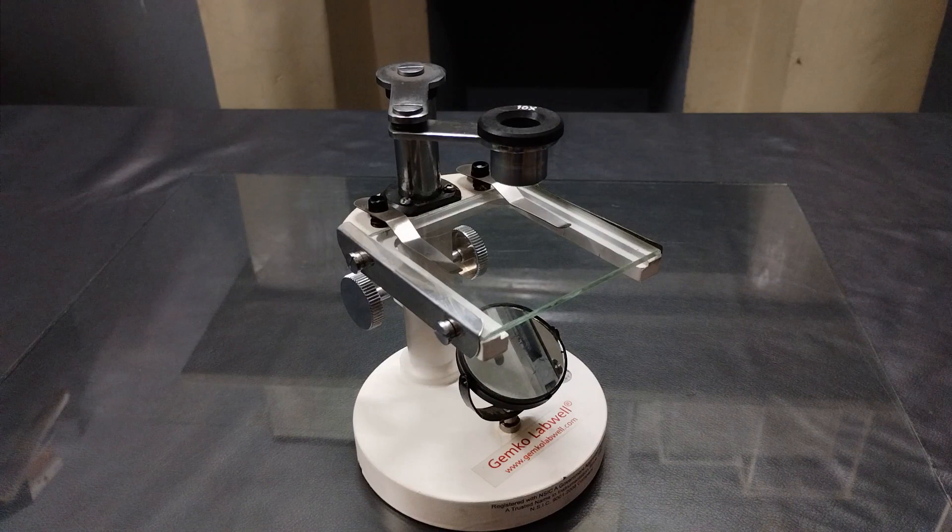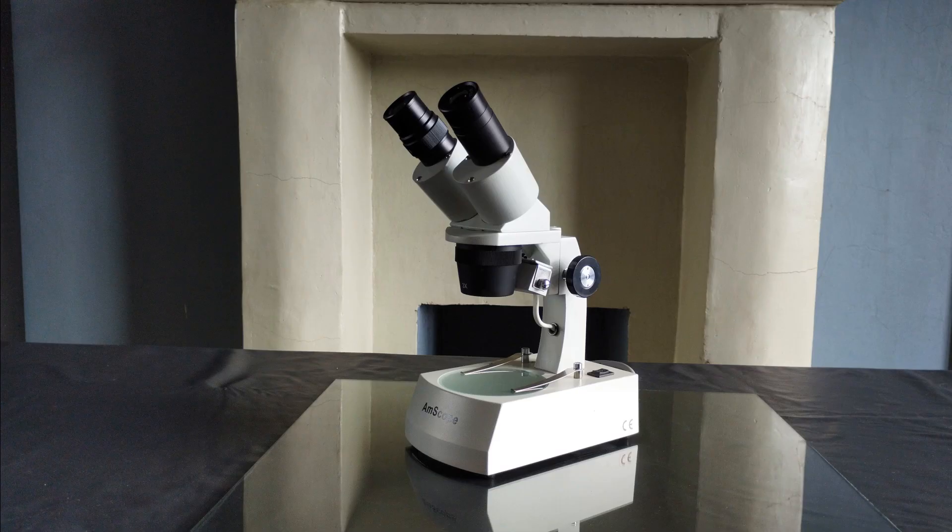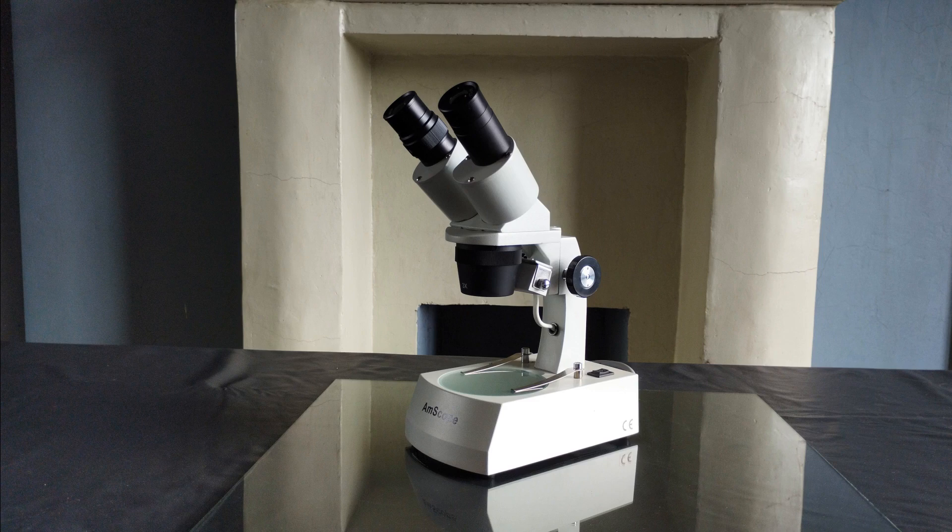Extremely easy to use, versatile, and comes in quite handy in any typical high school biology lab. The stereoscopic binocular microscope is a more advanced modification of the simple dissecting microscope.